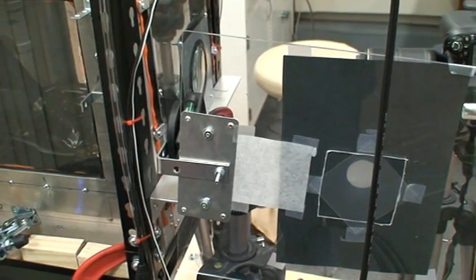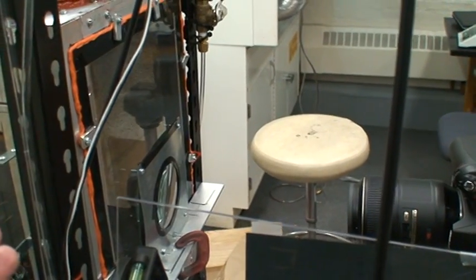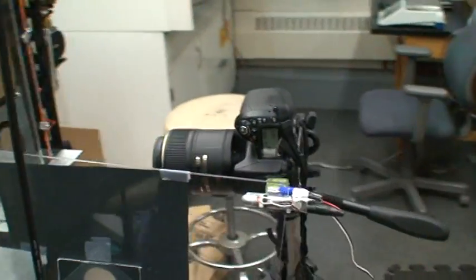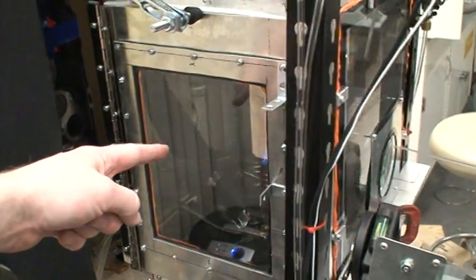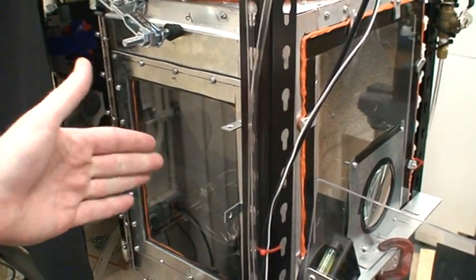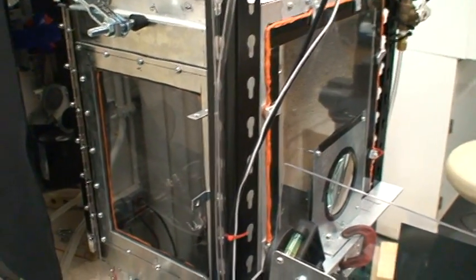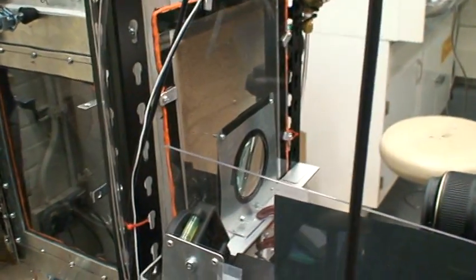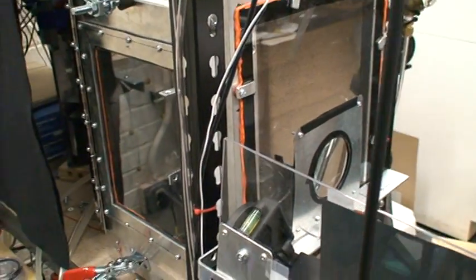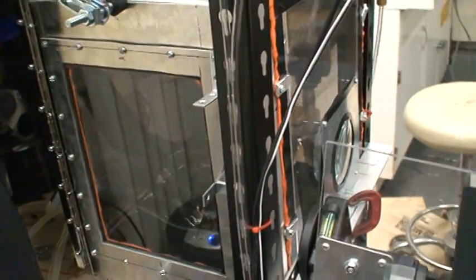I believe that's all that I want to say. These are inexpensive glass biconvex lenses where if you're trying to take an image very far away, the light is parallel at this first lens here, so it's parallel as it comes across, but as you get farther away the colors will separate out, so your image will get skewed if you're very far away. They sell more expensive lenses that will fix that, but we're using such a small test section here that it's not such a problem.